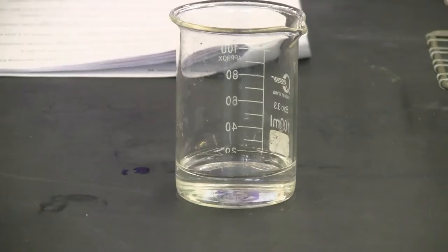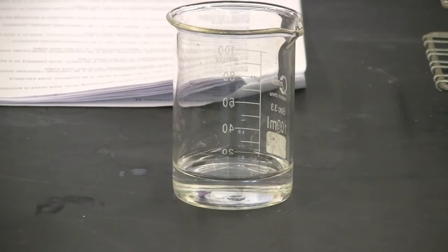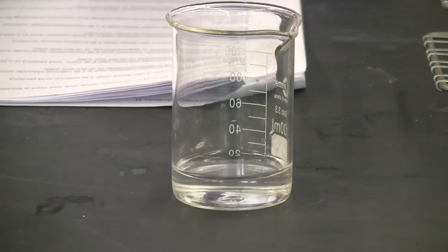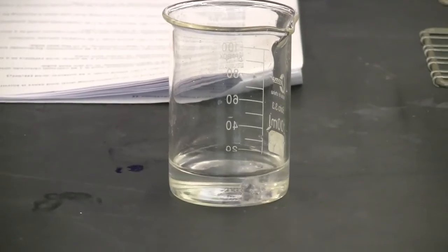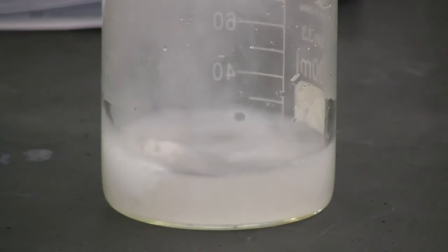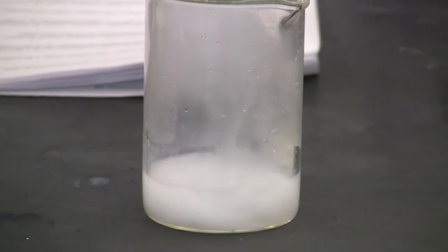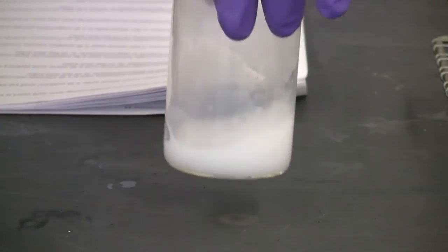Okay. Yep. So the last reaction, reaction 18, should be mixing calcium metal with distilled water. So distilled water is already in the beaker. I'm going to put a piece. You can see that already. So one piece is enough. Okay, so the reaction is going on. I don't like the smell. Oh, it's generating a lot of gases. Okay, afterwards, take a look at the solution itself.